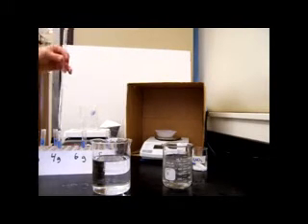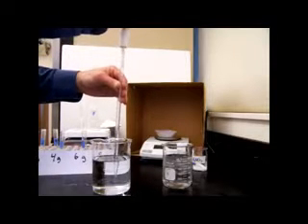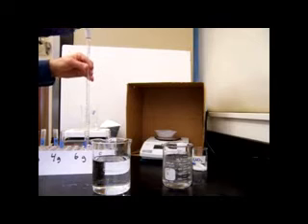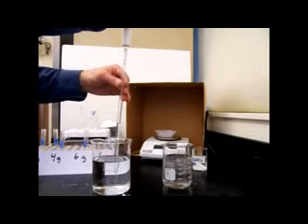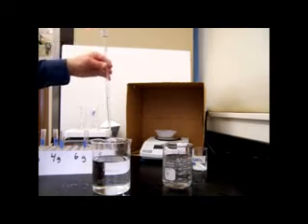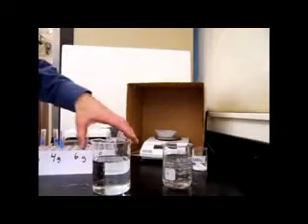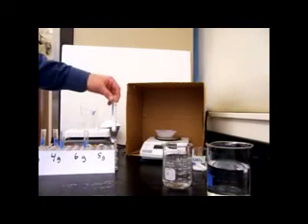So we're trying to make solutions here with different concentrations. Concentration is the ratio between solute and solvent. So our solvent here is water, and we're having 5 milliliters of water in each of our solutions, and then we'll vary the amount of the solute, the salt, potassium nitrate. Okay, so we made up our 4 solutions with low concentration on up to a high concentration.